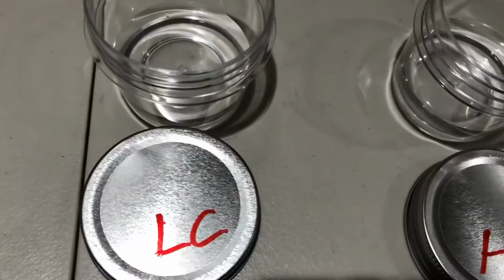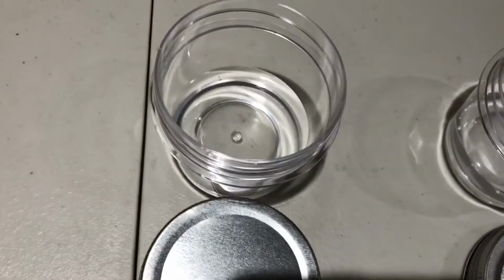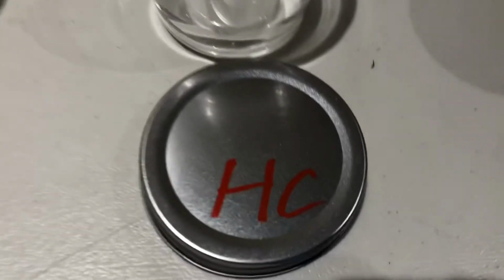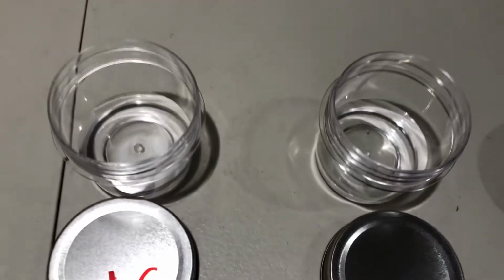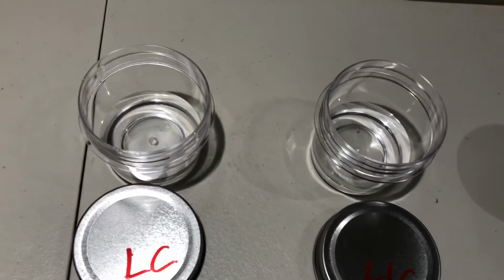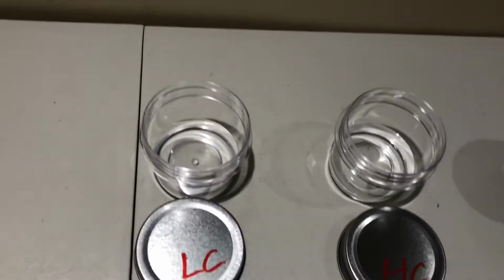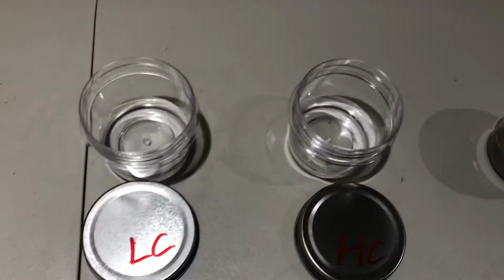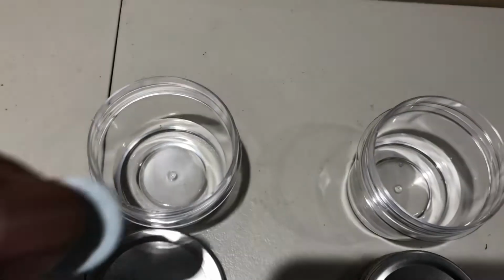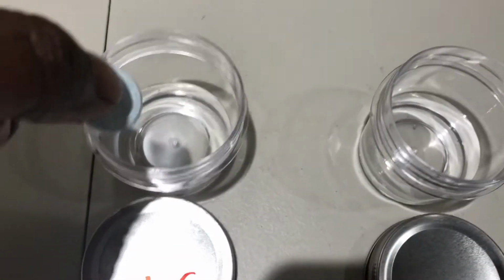All right, folks, back again. Now we have our low concentration acid, hydrochloric acid at low concentration, more dilute. And we have our higher concentration HCl acid in this container over here to the right. Now what I'm going to do, once again, is drop the pills in and let's see if we can see any type of significant difference. Now technically I'm supposed to drop them in simultaneously, but since I'm working with one hand, no problem, here we go. Hopefully the half a second difference doesn't make a big deal.